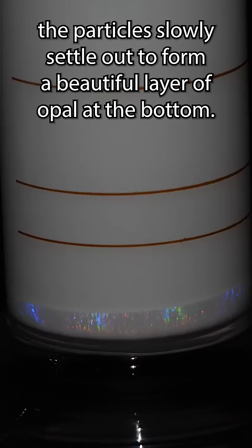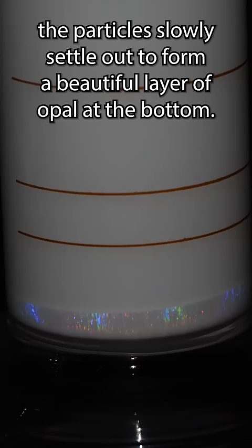When it's done, just pour the solution into a tall container and let it settle out for a few months. As days and weeks pass by, the particles slowly settle out to form a beautiful layer of opal at the bottom.